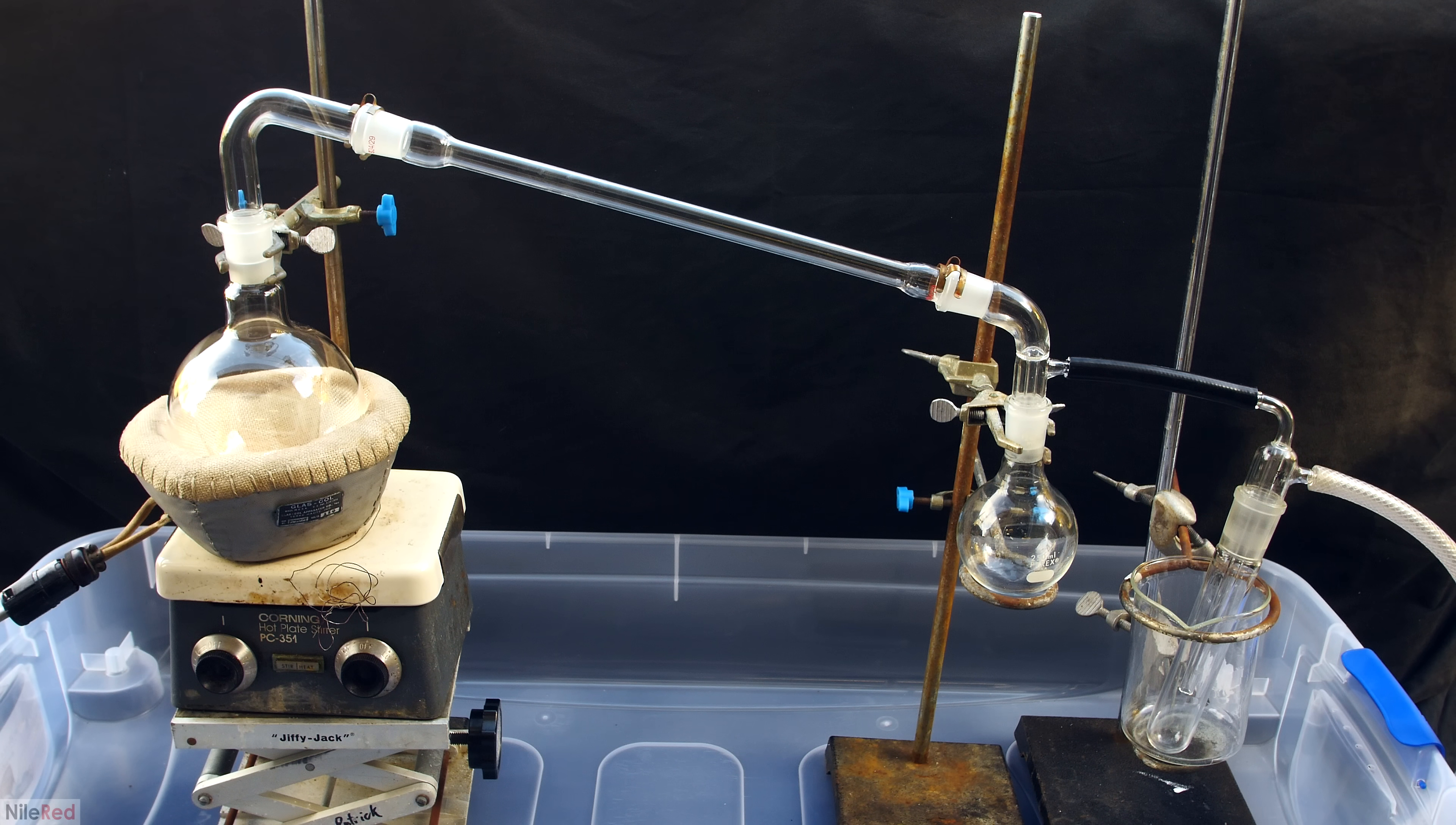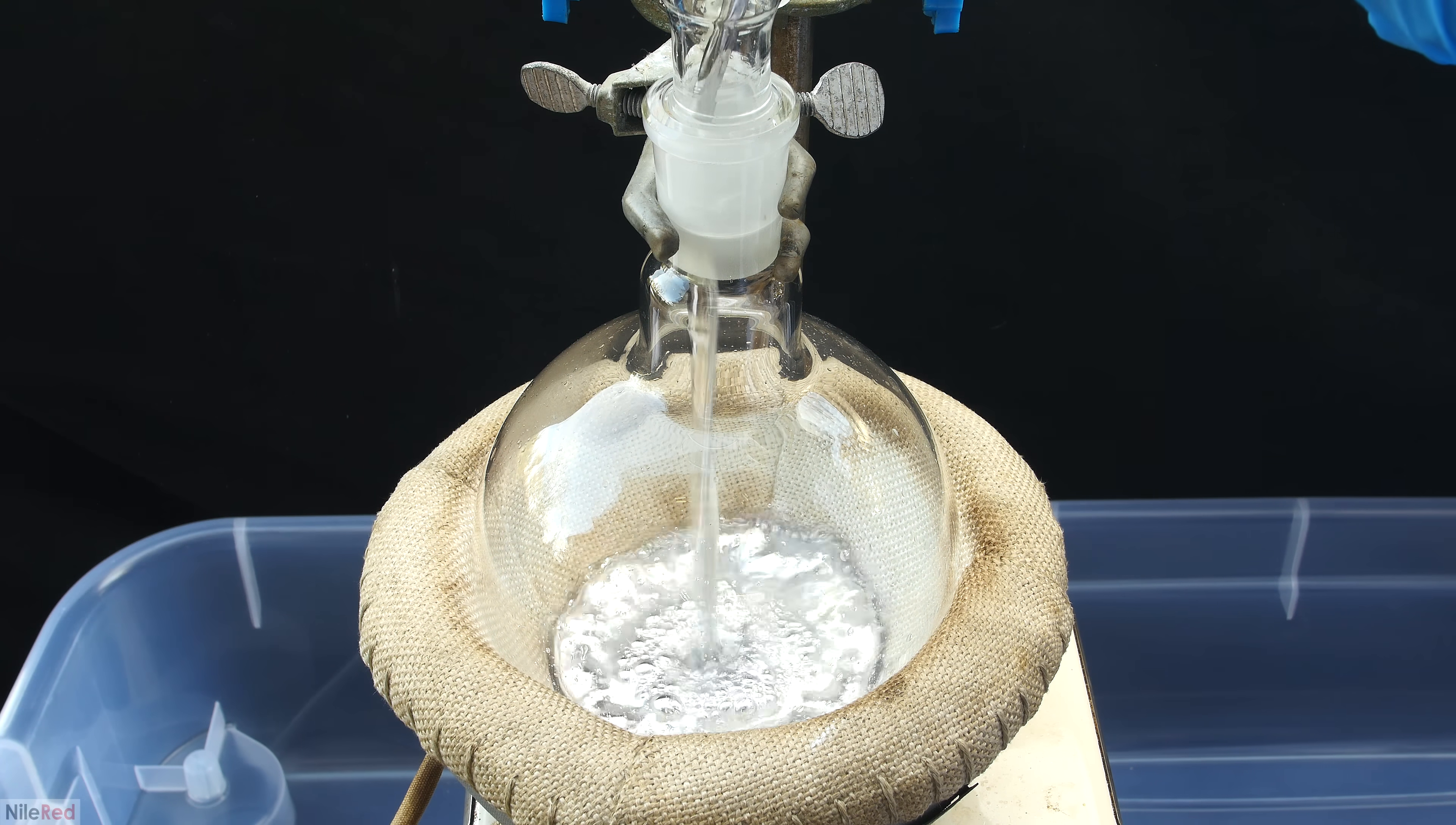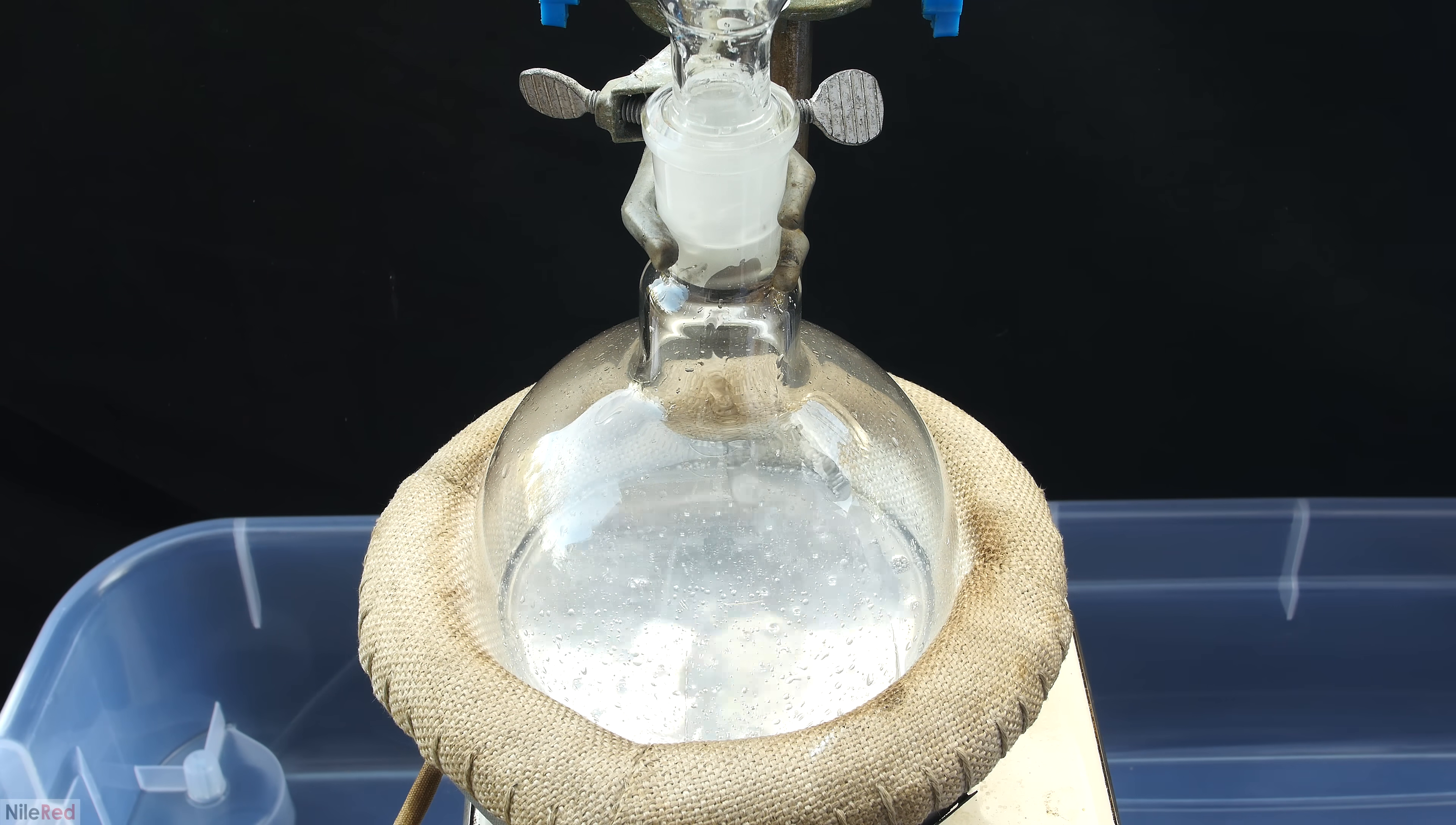In this video though, we'll be heating up mercury to its boiling point and generating a lot of mercury vapor. Mercury boils at a relatively high temperature, so there is a risk of cracking or breaking the glassware under the heat. If the glass were to break, it would release a crazy amount of mercury gas into the air, and on top of that, I'd probably have some hot mercury spilling and splashing around. Anyway, with that implicit warning in place, we can get things started.